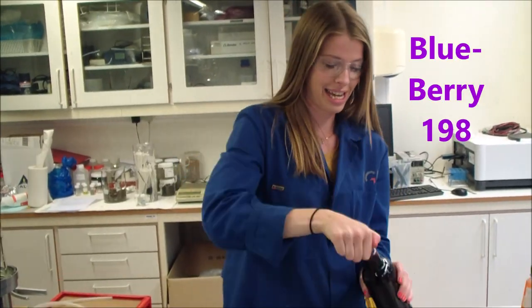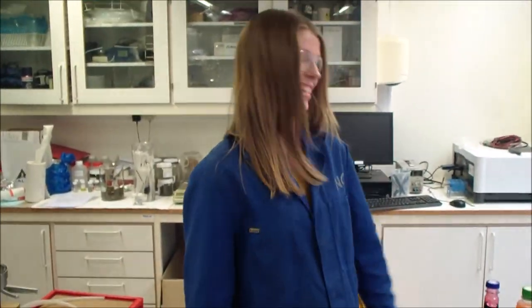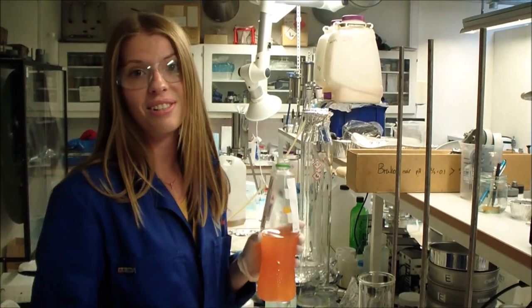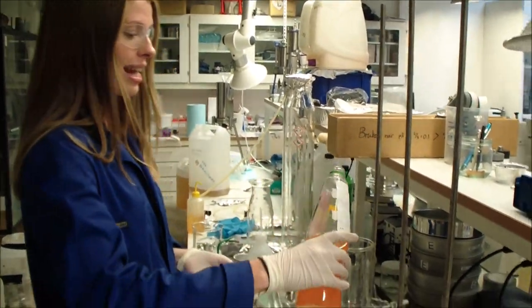Ninety-seven, ninety-eight, ninety-nine, two hundred. Yes! Now we're going to put this through a special filter that we use for microplastics, and that was it.